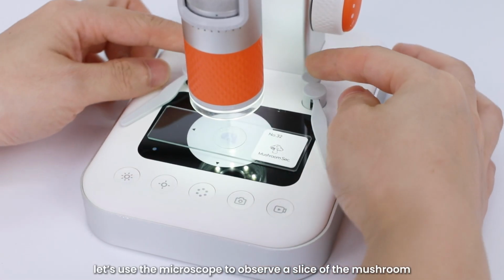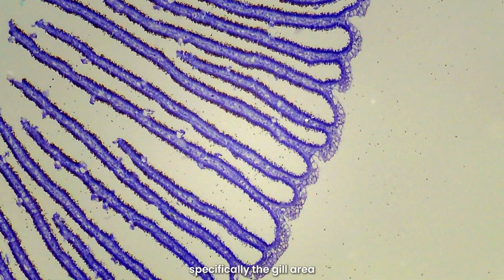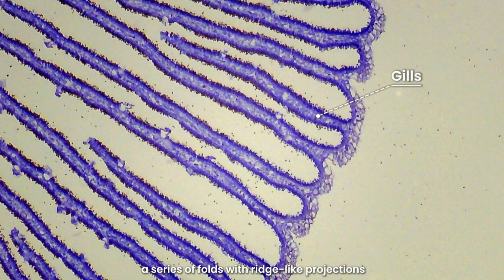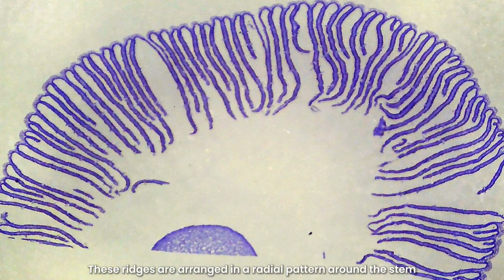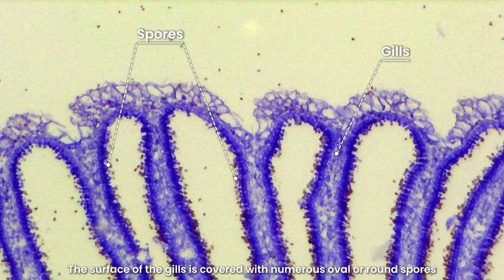Next, let's use the microscope to observe a slice of the mushroom, specifically the gill area. You will notice that the gills appear as a series of folds with ridge-like projections. These ridges are arranged in a radial pattern around the stem. The surface of the gills is covered with numerous oval or round spores.